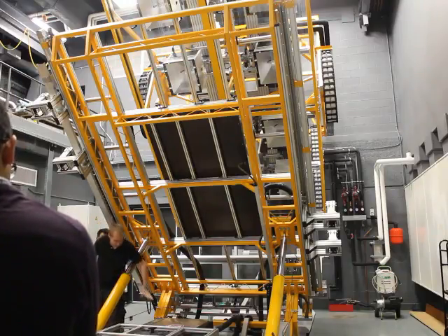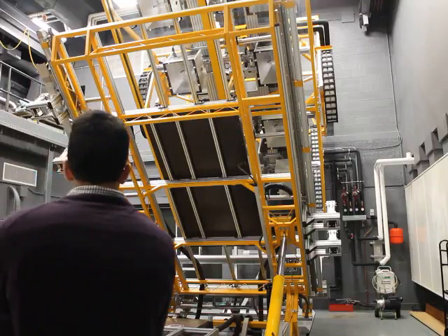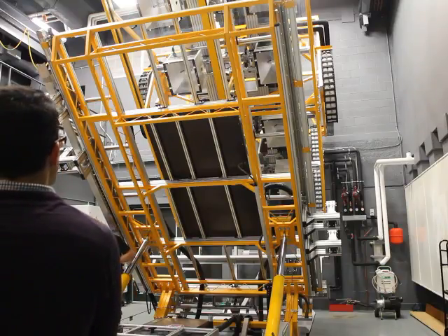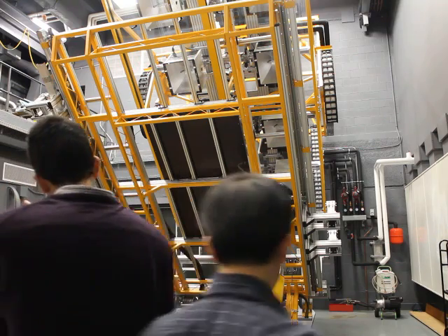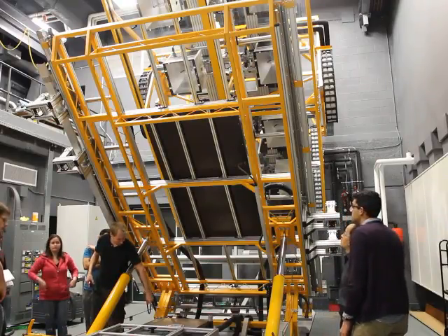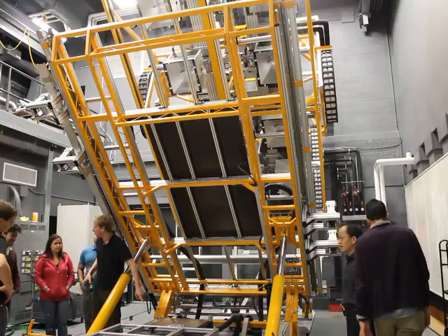This here is oil. It looks like water. Never put water in there. If there should be a hole or something like that, you will call us anyway, I think. But never put water in there. It's written there: use only silicone oil. M40 165 10. Do not fill in water. Please don't fill in water. It can destroy the machine.